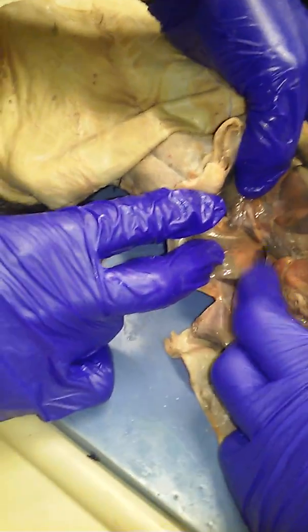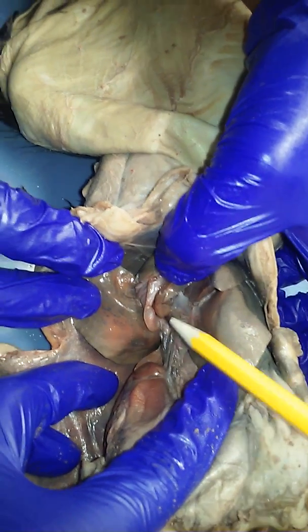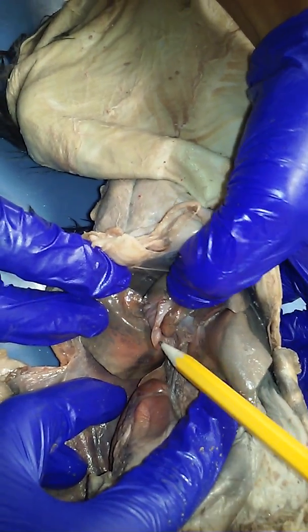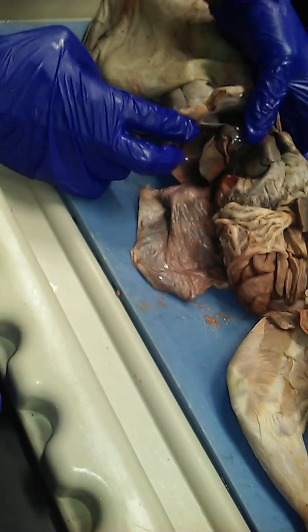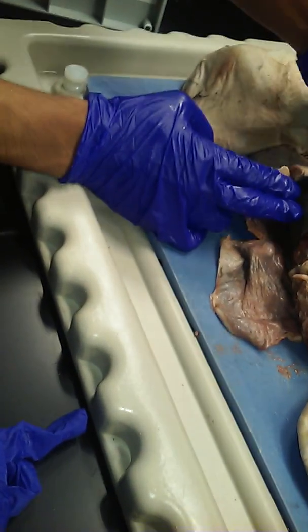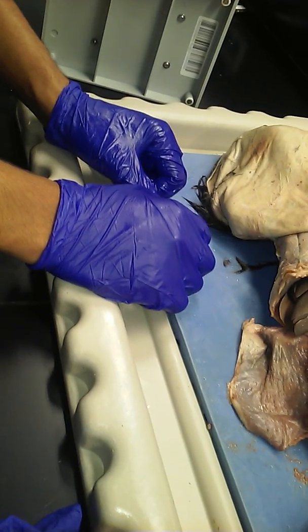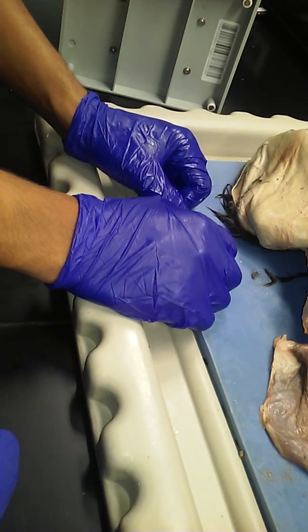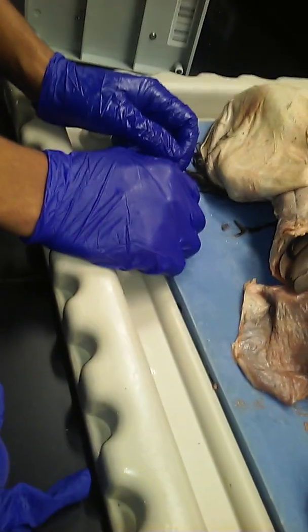Get the right angle between this and the left. You'll come here like this. There you go. Yeah, pointing to it. And that's the gallbladder, between the medial and lateral liver. Between the right medial and lateral. Don't put it between the right and left medial, put it between the right medial and the right lateral liver.